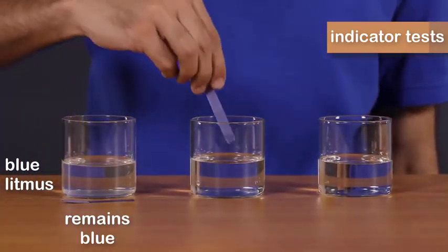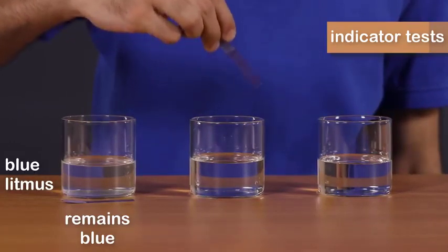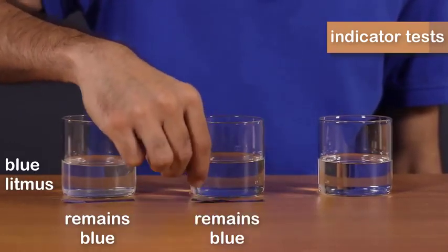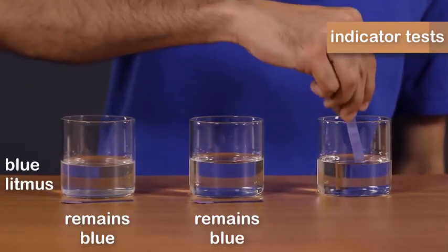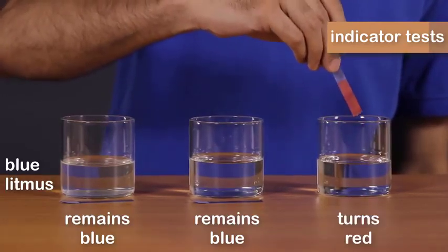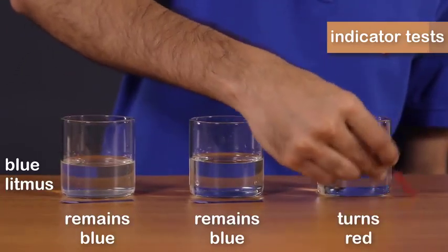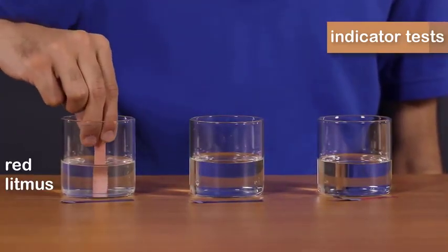Now let's try it for the second solution. Again, there's no color change. The blue litmus remains blue. Now let's try it in the third solution. Oh, there you can see the blue litmus paper turns red in color. Now let's try it with the red litmus paper.